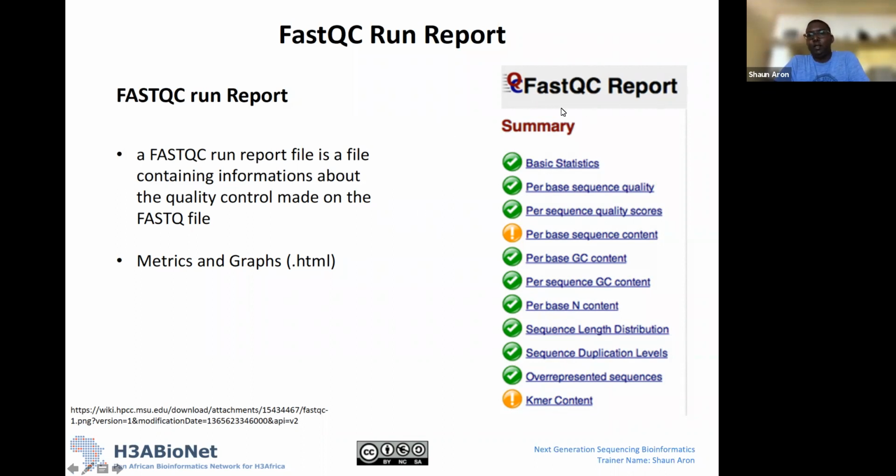Okay, so we're starting at the top of the file. Essentially, on the right-hand side or the left-hand side, you'll see the FastQC report summary. These are all the different sections of the report, and we're going to go through these one by one.